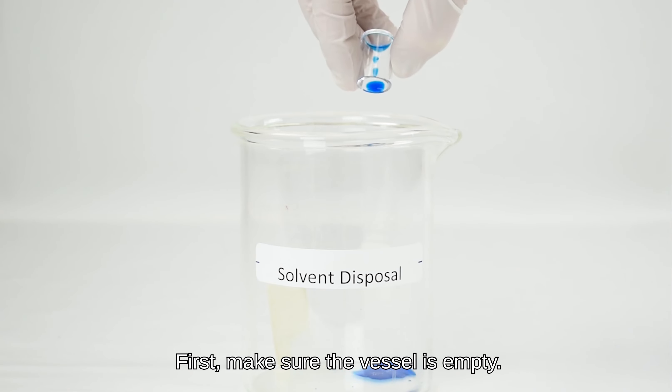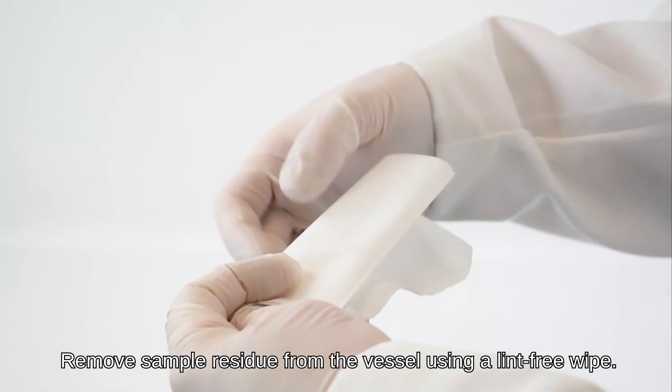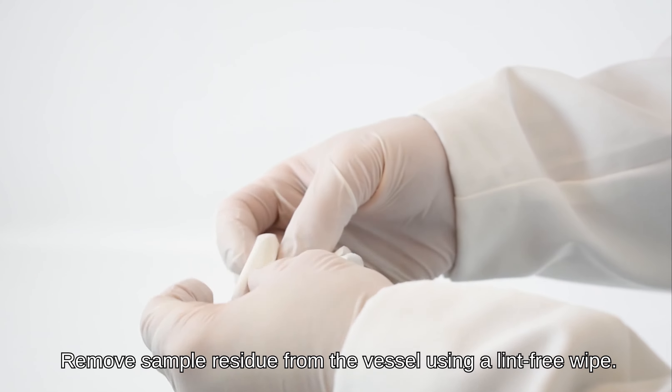First, make sure the vessel is empty. Remove sample residue from the vessel using a lint-free wipe.